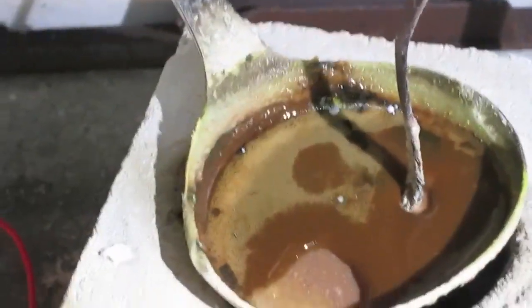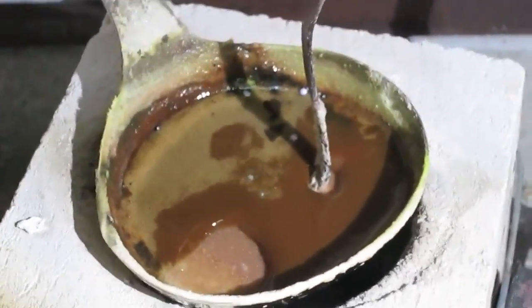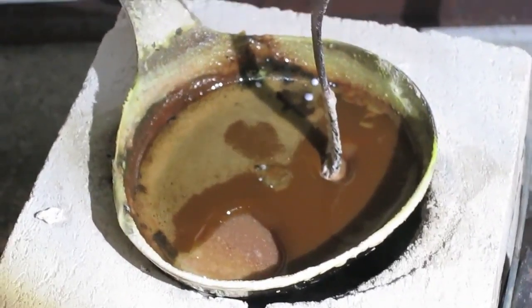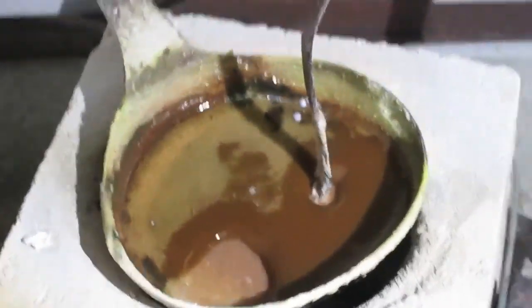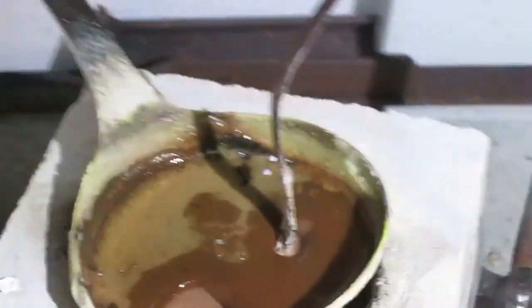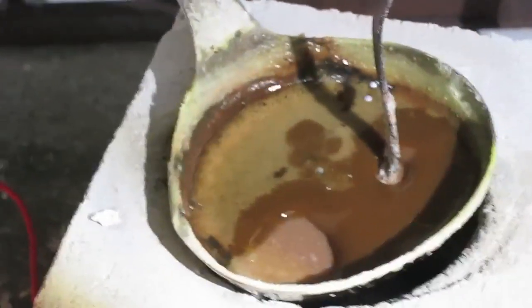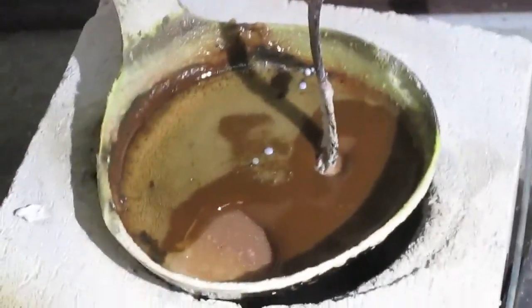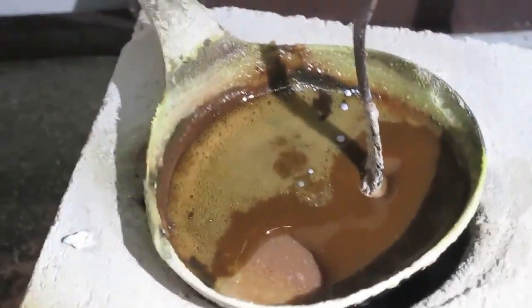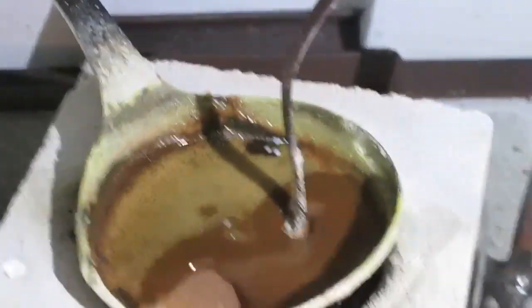As you can see here, you can see sodium metal bubbles. The small grey bubbles are sodium metal, developing along the center at the cathode, but they drift towards the edge. The problem is picking the small sodium pieces out of the melt — I tried it with this piece but it doesn't take them out. Okay, I'll try again.